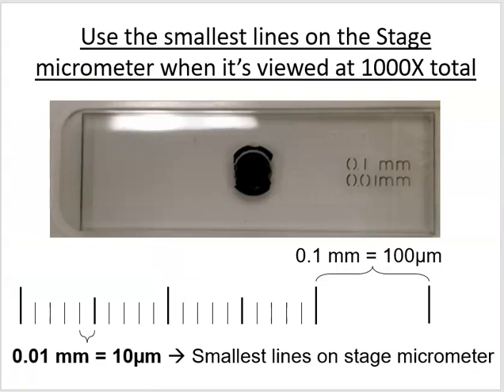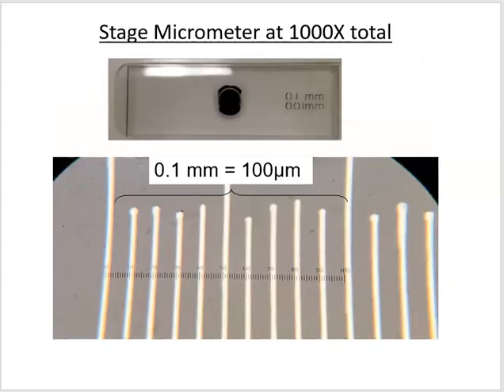And so if you go back and look at the lines that I showed in the beginning in my little cartoon, we've been using these bigger lines over here that are 1/10 of a millimeter or 100 micrometers. And one of those spaces on the stage micrometer is broken up into 10 smaller spaces. So those guys are going to be 10 micrometers in between each of these lines on our stage micrometer. So think about that. Now we know the size of these things that we're using.